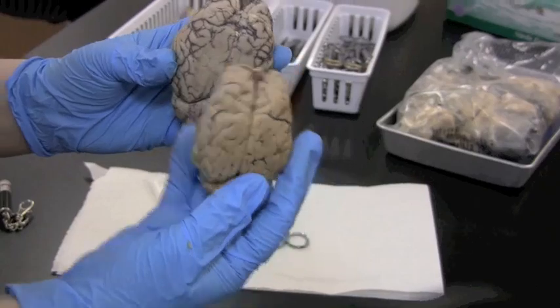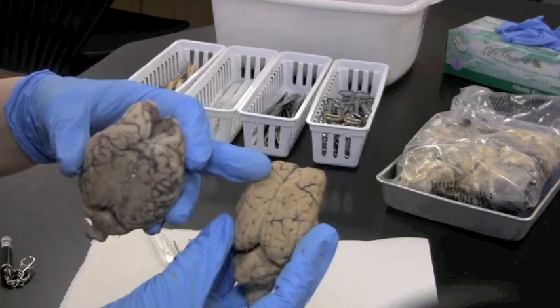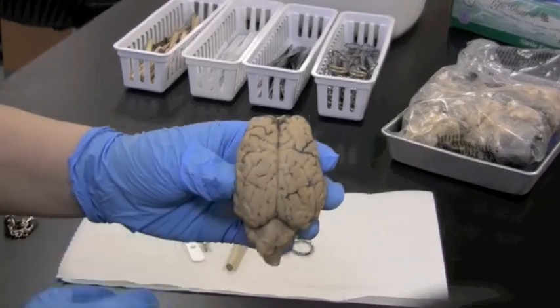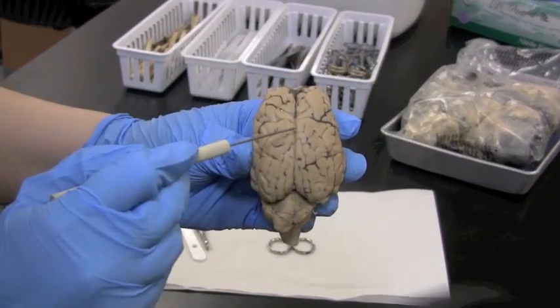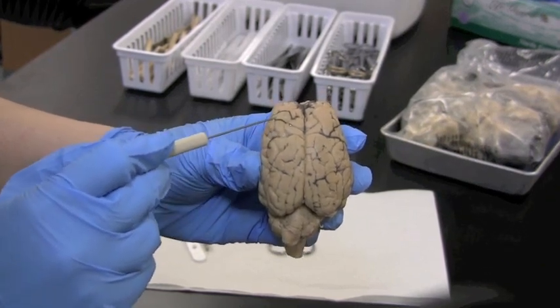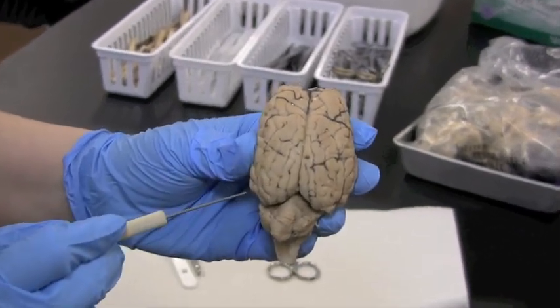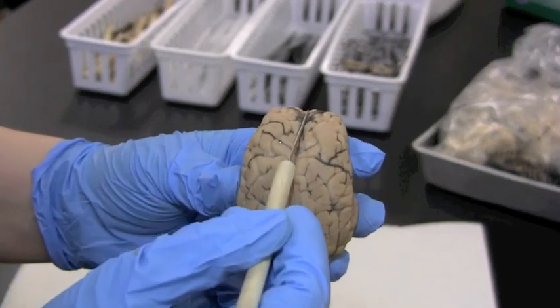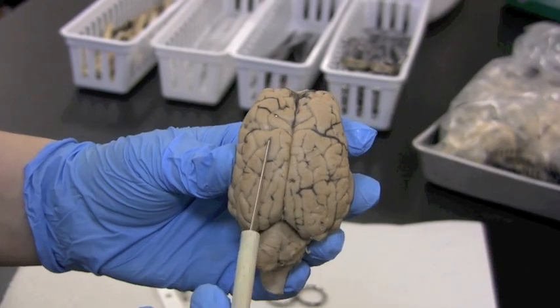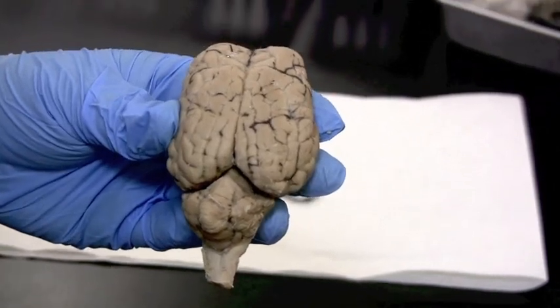We have a smooshed, flatter version here; this one shows a little better detail in the superior view. You've got all the gyri — remember, gyrus is singular, gyri is plural — and all these ridges across the cerebrum are gyri. Down the center is the longitudinal fissure, which divides the left and the right hemispheres.